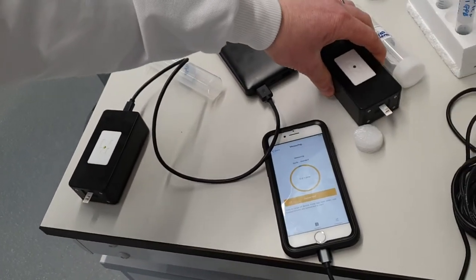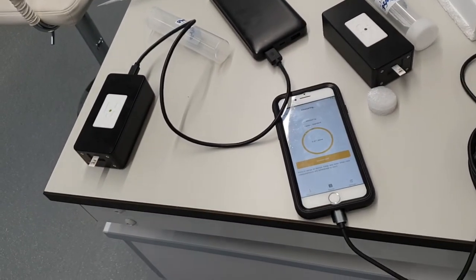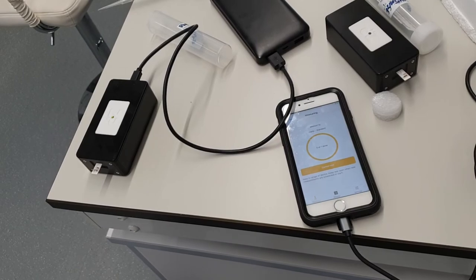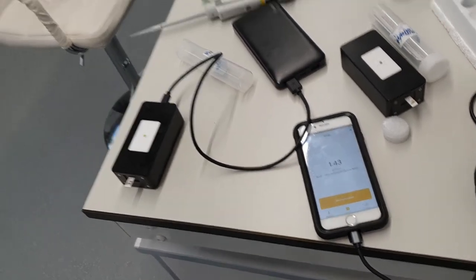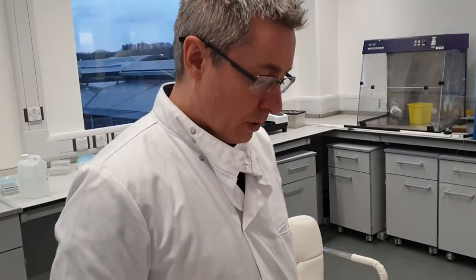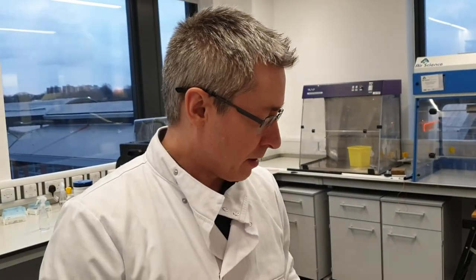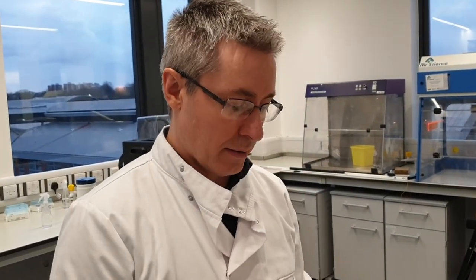We'll get a score back. And that's it, 1.43. So we've tested other garlics this afternoon, but in this particular case, this puree had a score of 1.43.